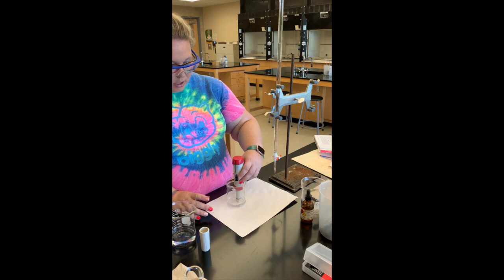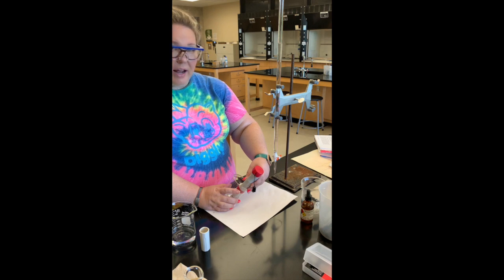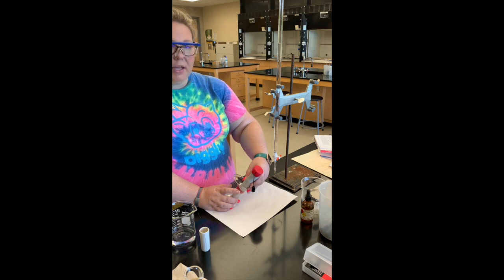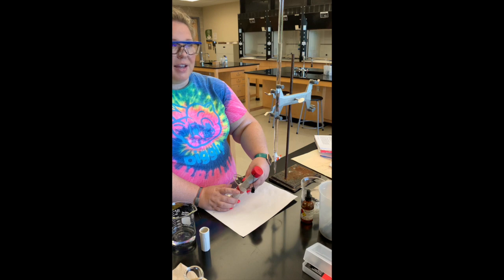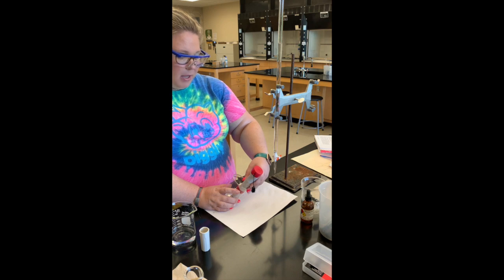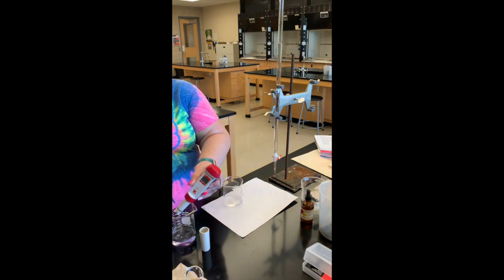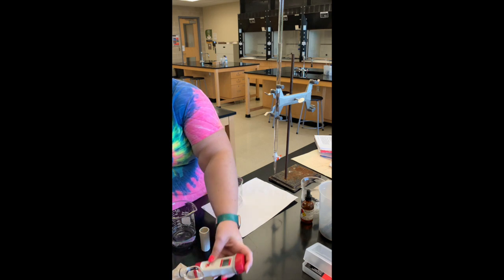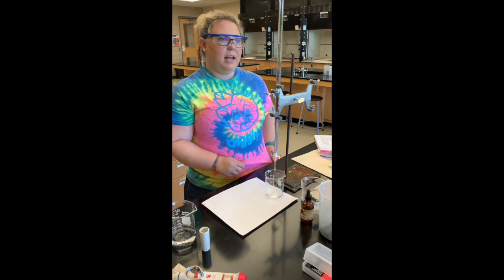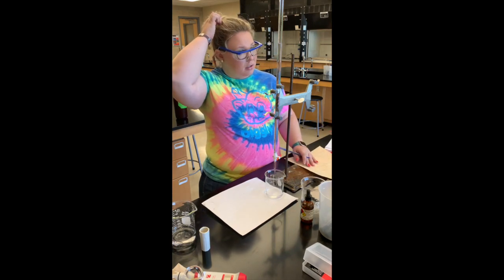I'm going to dip the pH meter into my solution and let it equilibrate. The pH and milliliters of sodium hydroxide added will be in the PowerPoint so you can get that data. Our pH is 3.5 with no sodium hydroxide added yet. Now I'm going to add one milliliter at a time and take the pH each time.